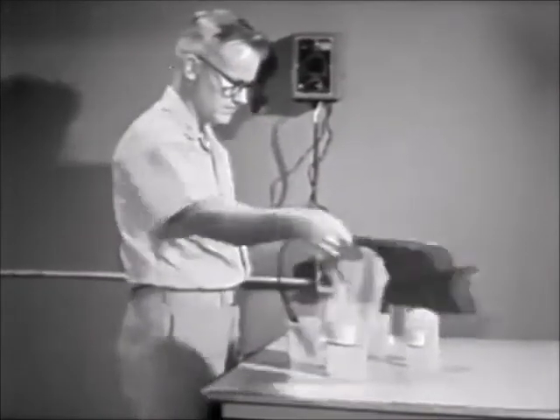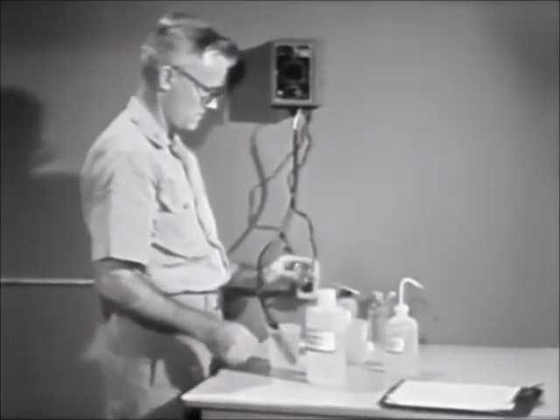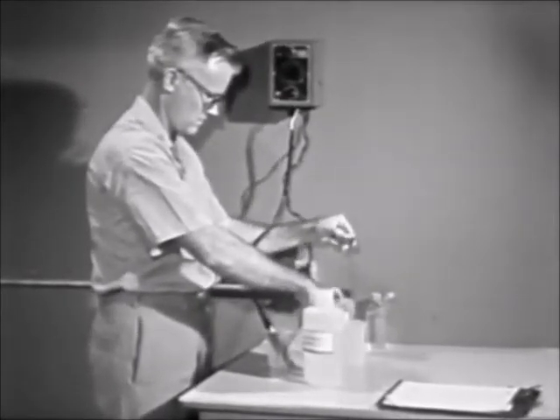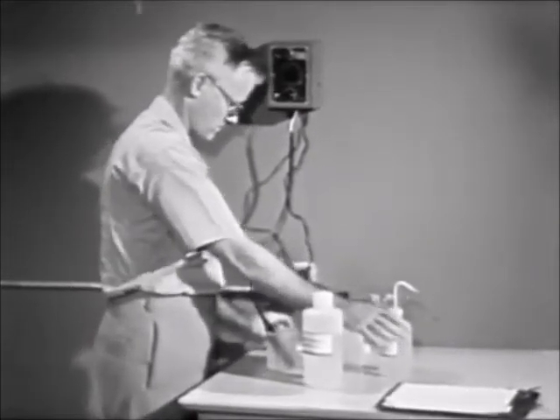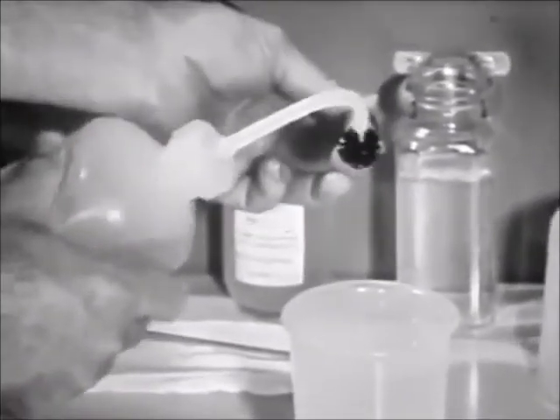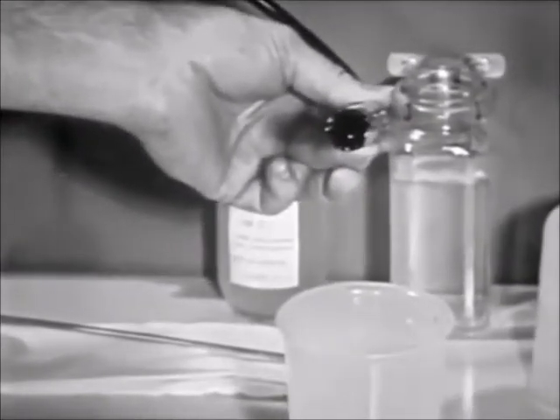Accurate testing requires that proper care of equipment be taken. Rinse the thermometer and beaker with distilled water to be sure that no deposits remain on them. Distilled water from shipboard distilling plants is adequate for this purpose. Rinse and store the cell in distilled water. If it is necessary to store the cell out of water at any time, rinse the cell well before it dries.